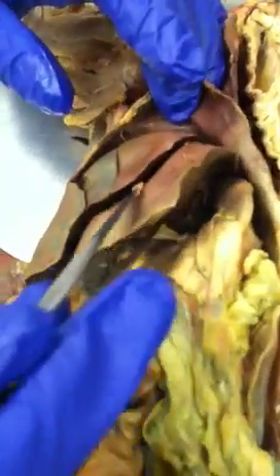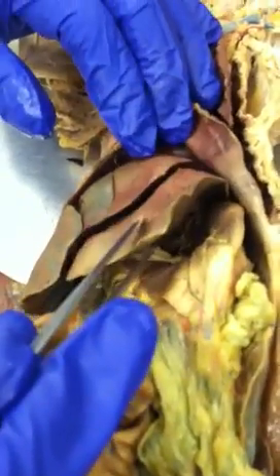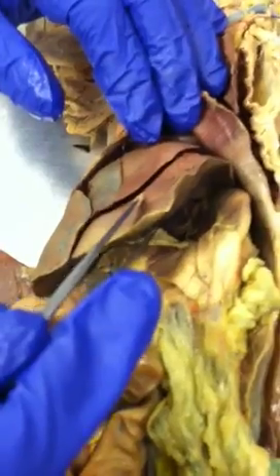All right? So this one here would be the left lateral lobe. You see this one here? So if I put a pin over here, you would say left lateral lobe. All right? Then here would be the left median lobe.